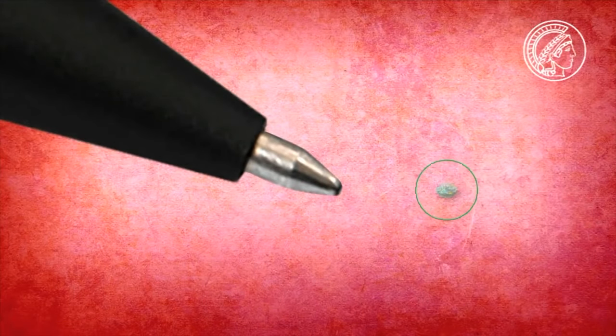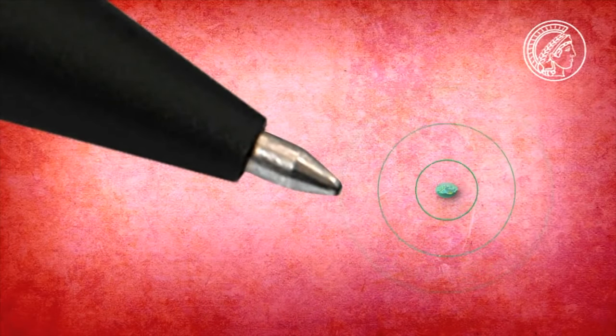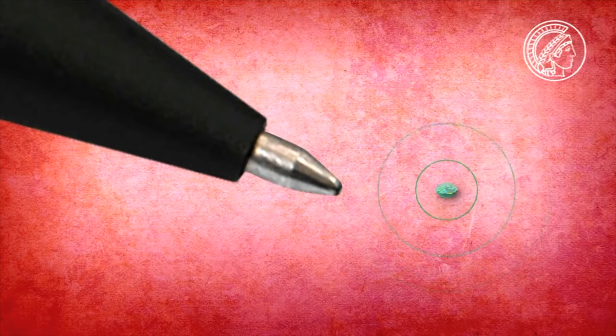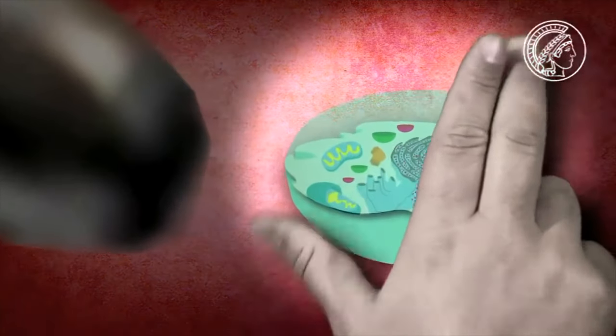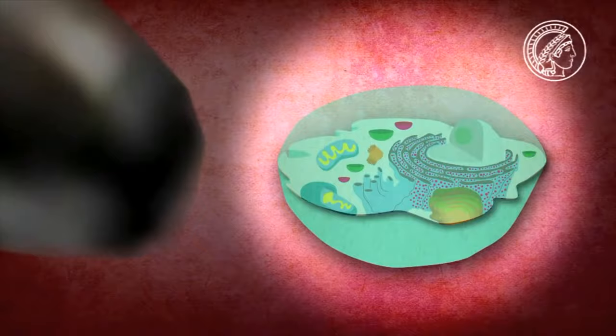Visible light is a wave with a certain length. An optical microscope uses its optical spectrum, from about 800 to 400 nanometers. And physics does not allow us to distinguish objects that are less than about half the wavelength. That is, with the help of a conventional optical microscope, we will not be able to distinguish anything that is less than 200 nanometers.